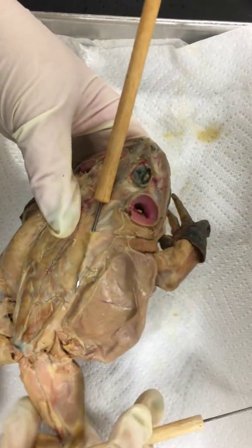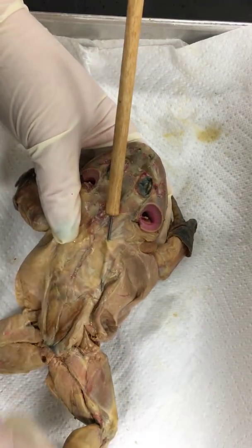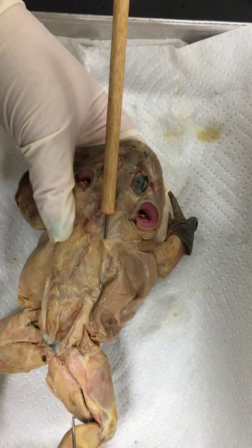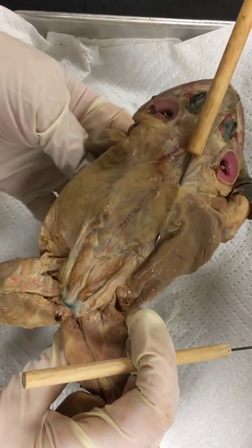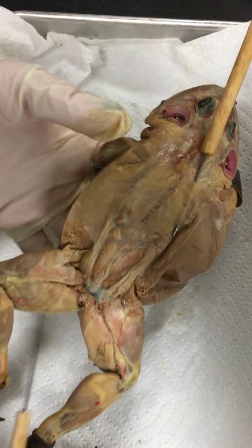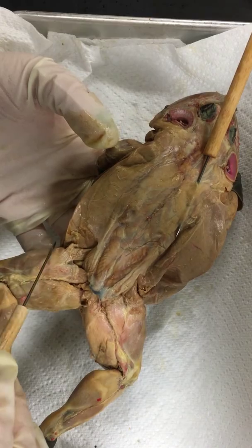Then we come on down here — see his big belly right here. These are his external obliques because we no longer have skin, these are his muscles. Then we keep going down, we've got his glutes and his triceps femoris.